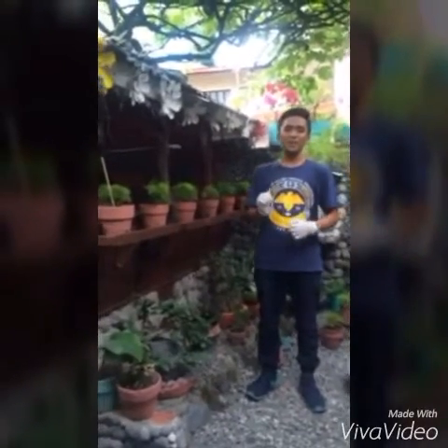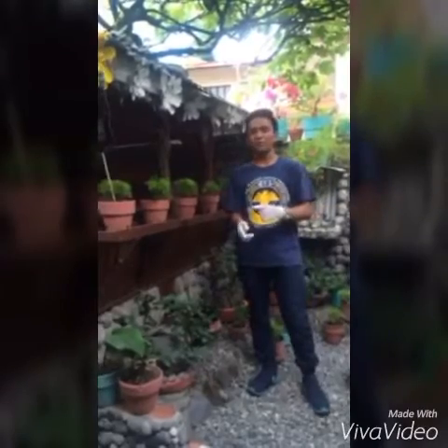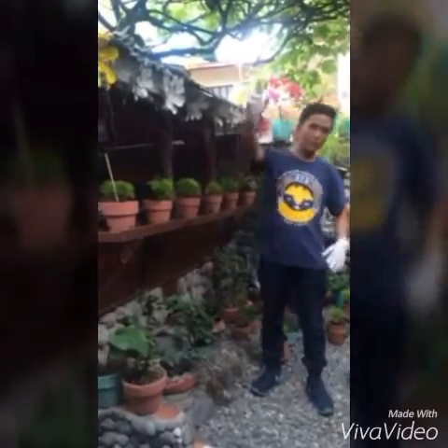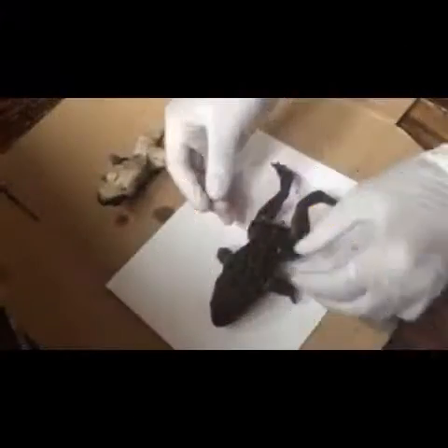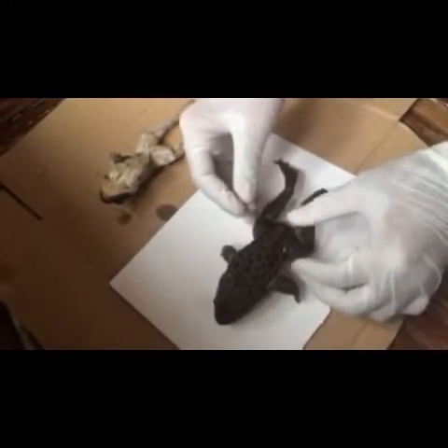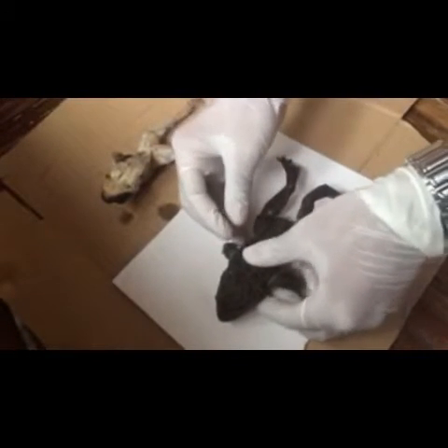Hi, I'm Julian David representing OT1A, and now I will discuss the external anatomy of the frog. Let's go! This is the dorsal view of the external anatomy of the frog.